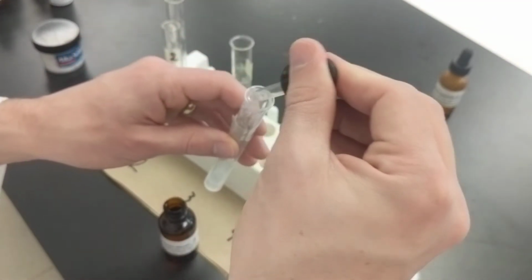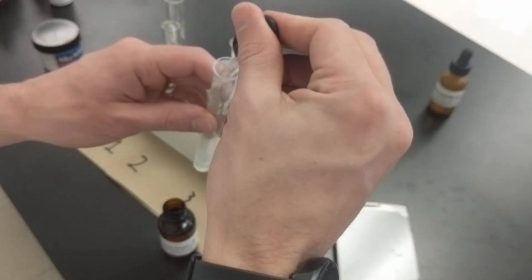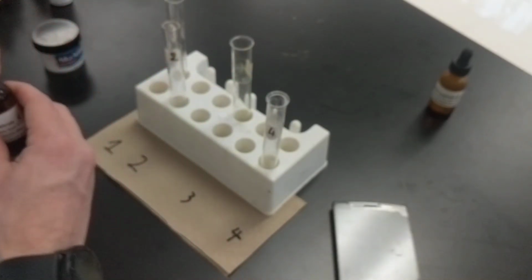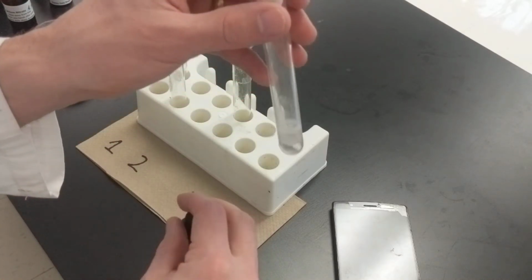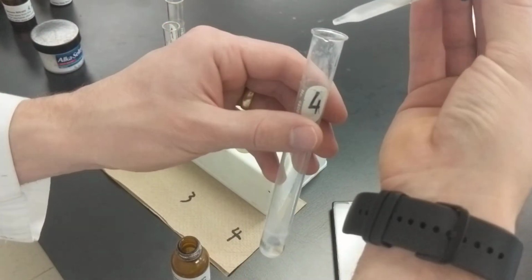So that's 1, 2, okay, watching as I put in the 1.